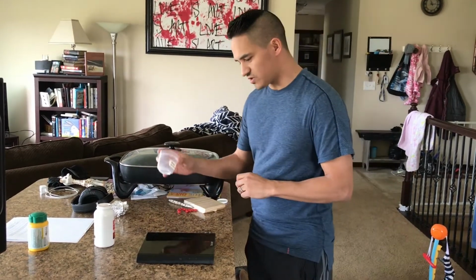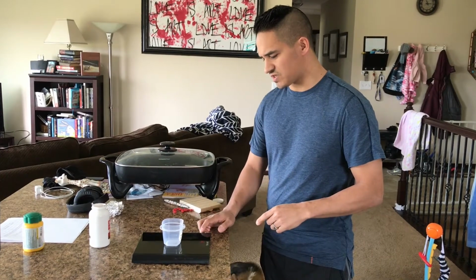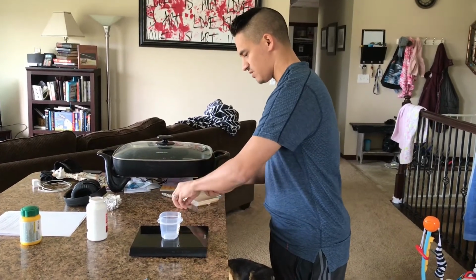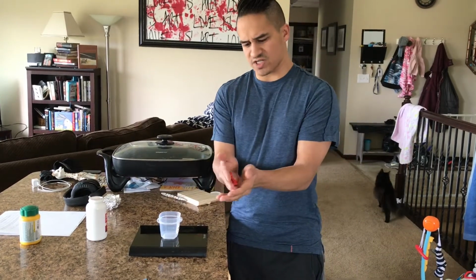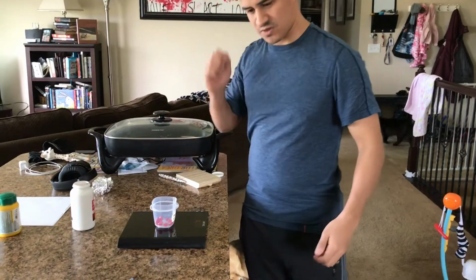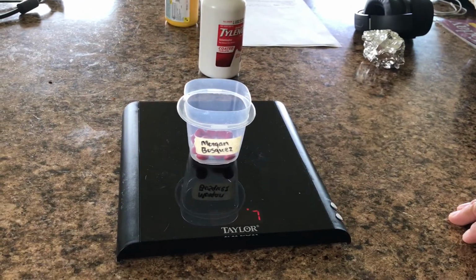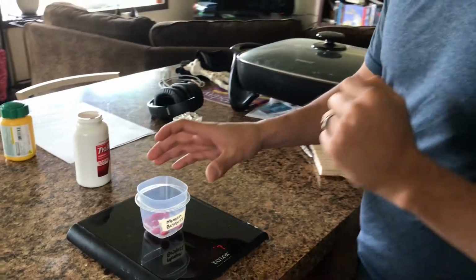All right, so first off, we're going to take some aspirin tablets. I'm going to put this on the scale first and zero it. That way our scale is able to pick up these tablets because they're pretty small, and the scale doesn't pick up mass super well. So we have a good chunk of aspirin here, but we're going to have a lot of them just because, again, we need enough for the scale to pick it up. So you need to record down the mass of the aspirin tablets shown on the scale. Looks like it says about 7 grams. So on your table for part 3, please record that number.